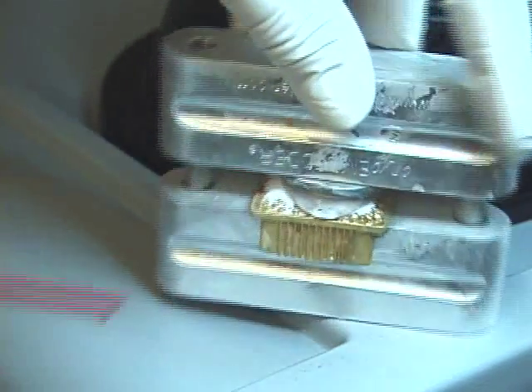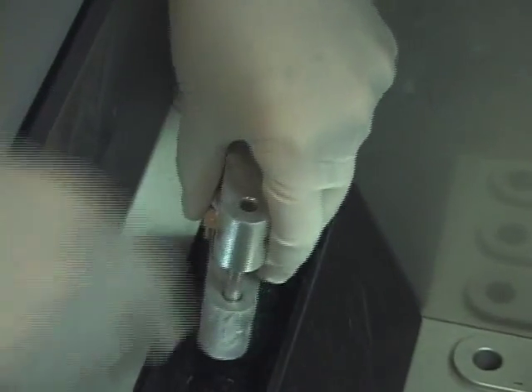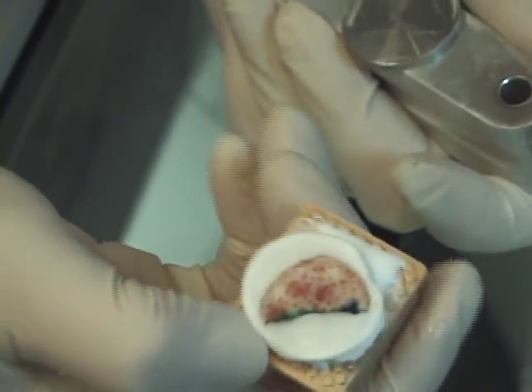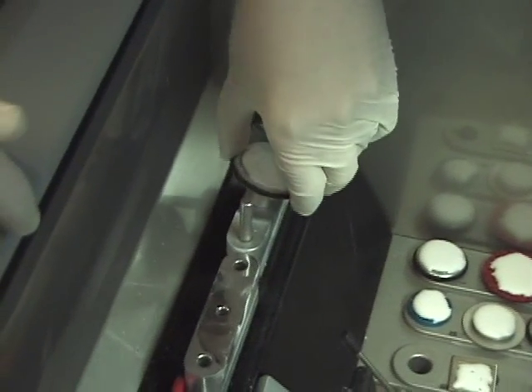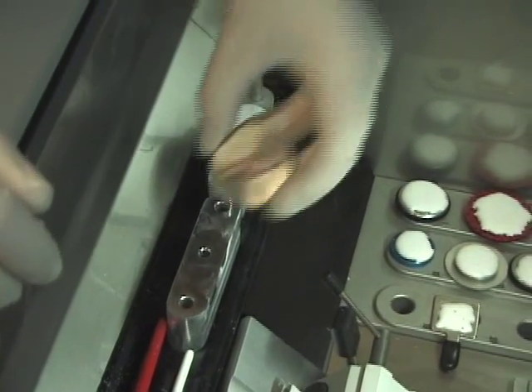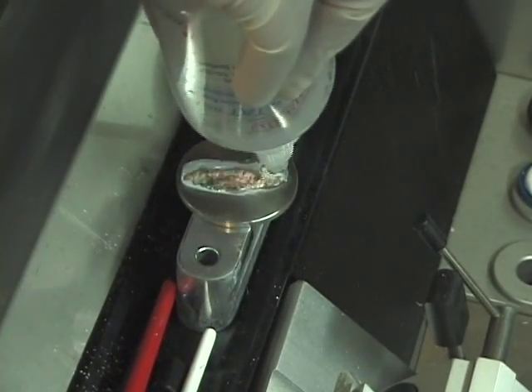Simply spray, lower back into the chamber, separate the chuck from the flat disc, and another perfect specimen with complete margins is ready to cut. There is a large flat disc included in the cryoembedder system for larger specimens — it will accommodate tissue that is the length of a microscope slide. The embedding process for larger specimens works the same as with the smaller discs that are the width of a microscope slide.